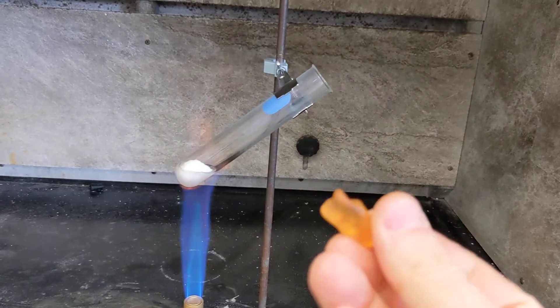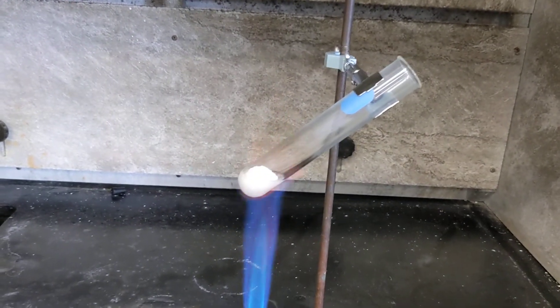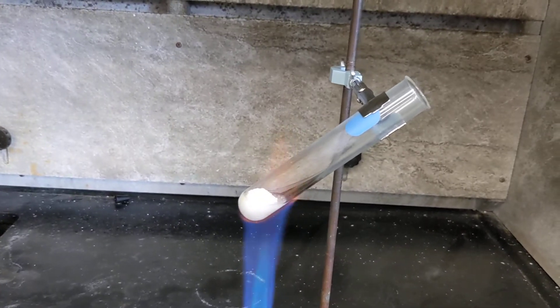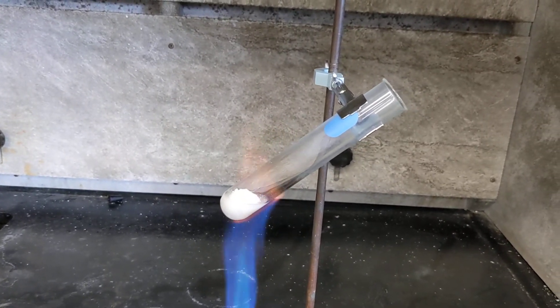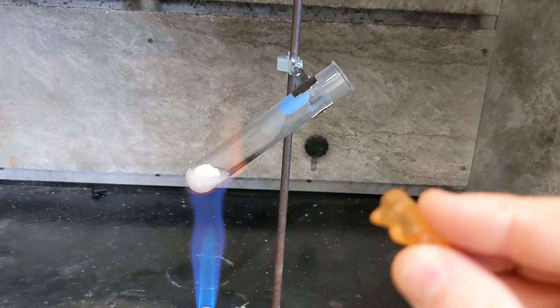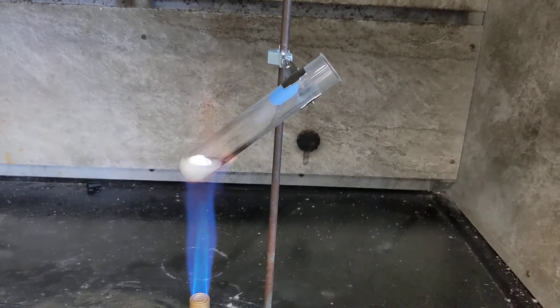So this sucrose in here, we're going to oxidize using the oxygen from the potassium chlorate, right? Rather than just burning this in air, it would kind of make a goopy mess, kind of burn kind of slowly.